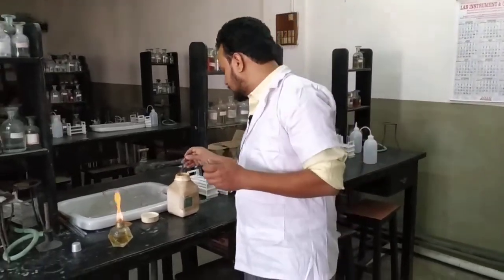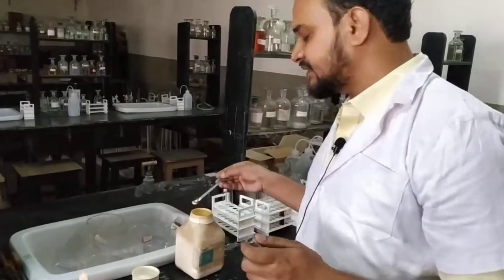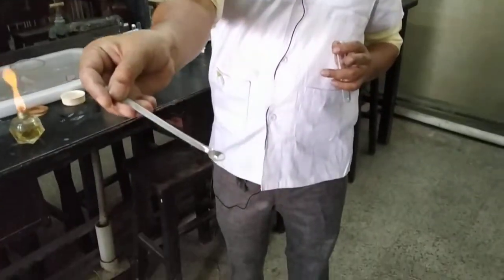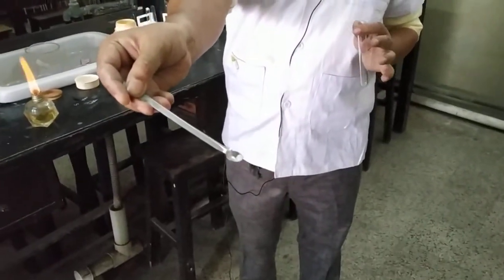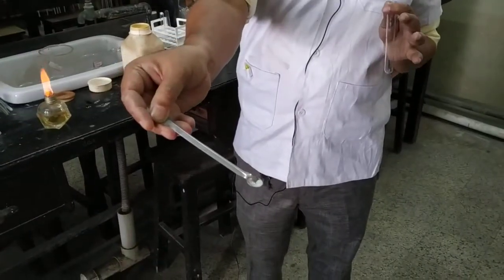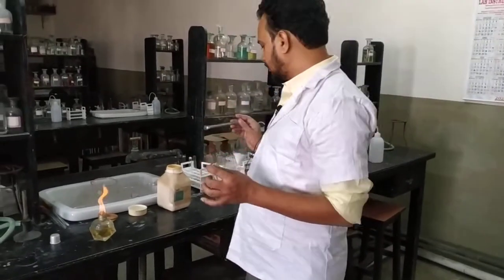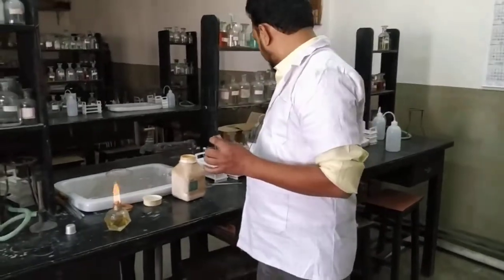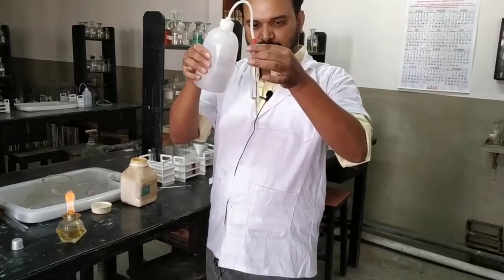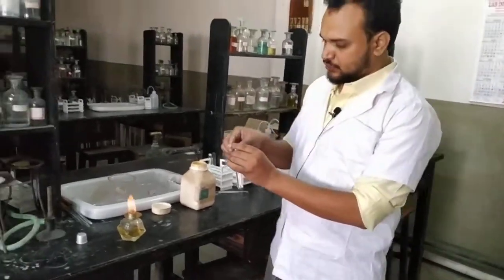First, we need to prepare an aqueous solution of benzoic acid. As I say repeatedly, take only a little amount of benzoic acid for the aqueous solution. It is not soluble in water at room temperature, so take only a little amount of benzoic acid with about half a test tube of water. You have to heat it to dissolve.